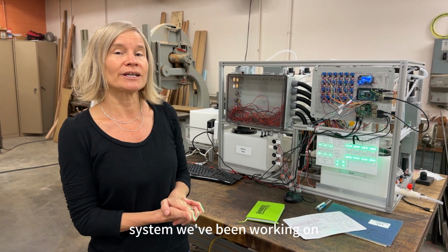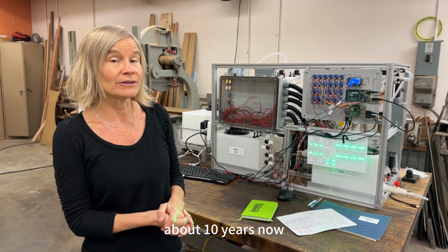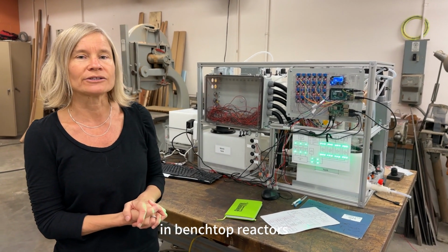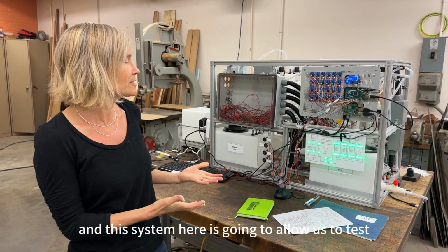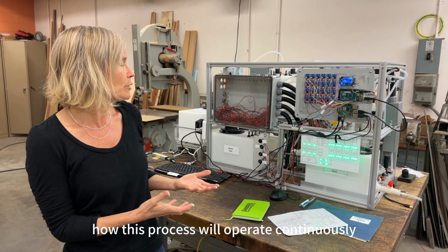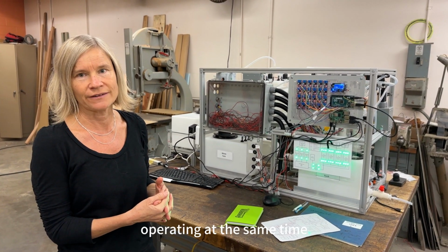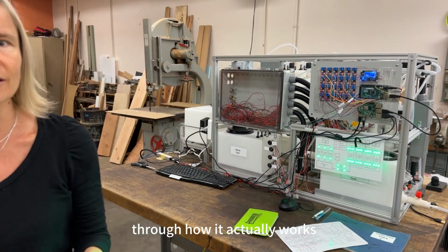I'm a professor here at UC Berkeley in environmental engineering, and we're really excited to show you our bench scale system. We've been working on ion exchange as a way to produce fertilizer from urine for about 10 years now, doing tests at the lab scale, like in benchtop reactors, both here in Berkeley and also in Nairobi, Kenya. This system is going to allow us to test how this process will operate continuously and under different configurations, where we have multiple columns operating at the same time. I'm going to turn things over now to Utsav to walk us through how it actually works.